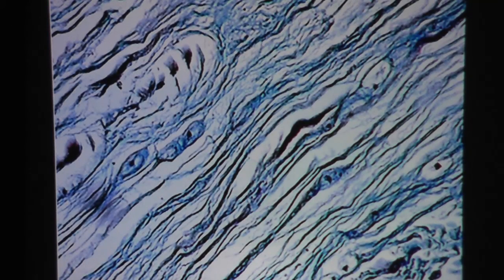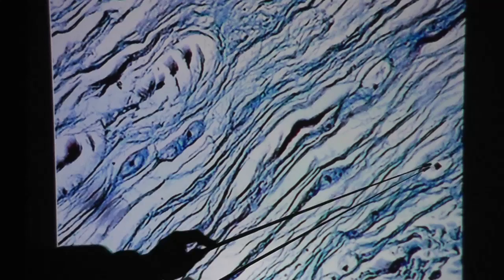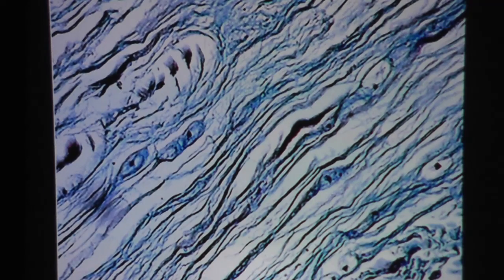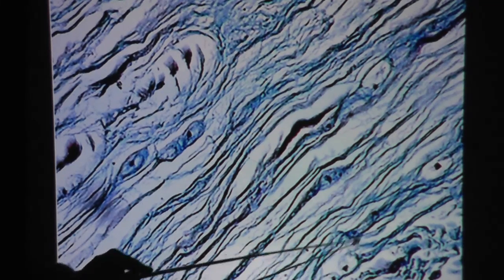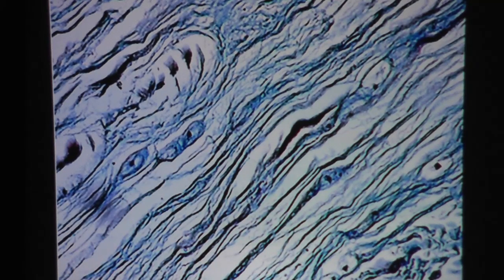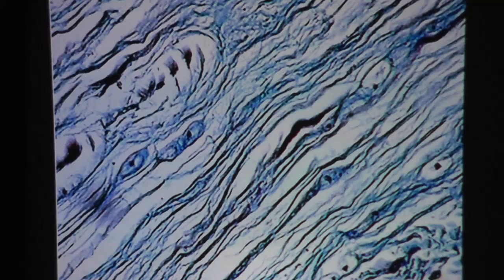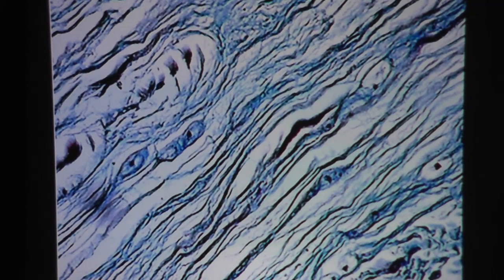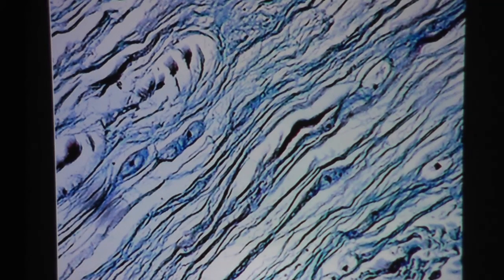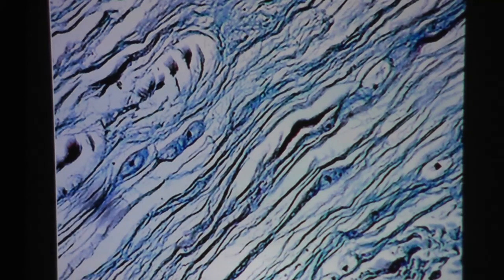In another view of fibrocartilage, if you see the nucleus, then you can see the chondrocyte. Those would be the nucleus of the chondrocyte — they live in a little space called lacuna. By the way, lacuna in Spanish means crib, so you can think of the little cell as a baby lying in the crib — a great way to remember it. Lacuna is the little space in which we find the chondrocyte. And of course, what's remarkable about the slides is all these wavy lines — that would be the collagen fiber.